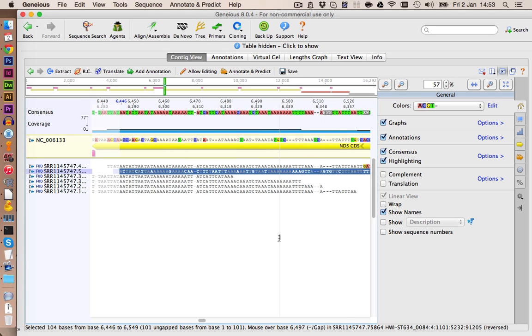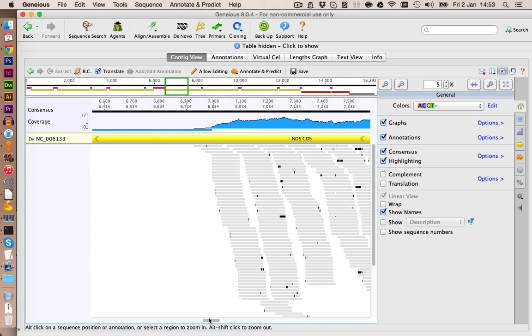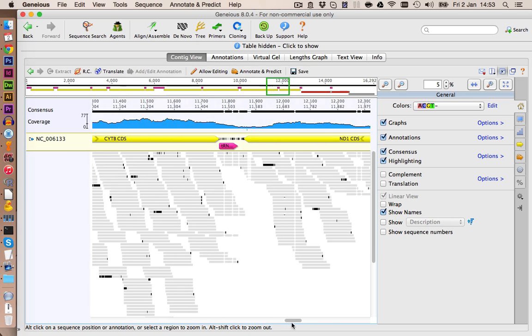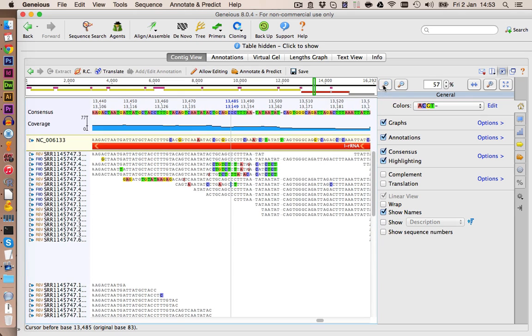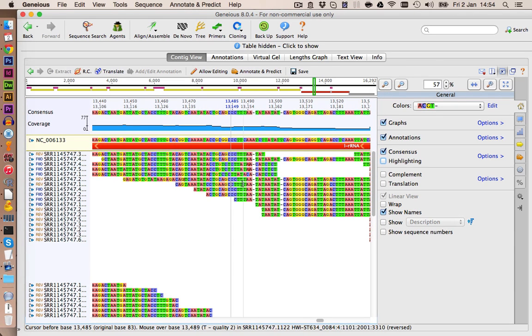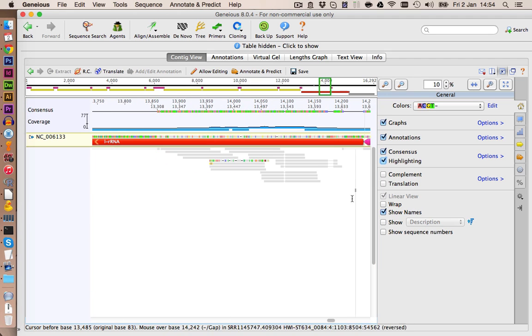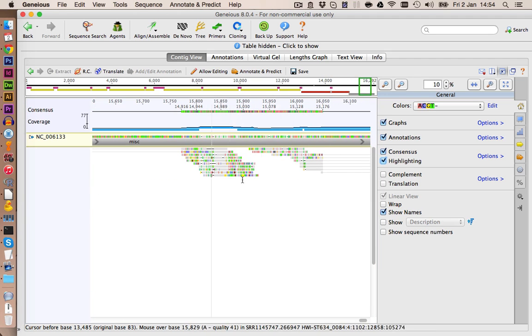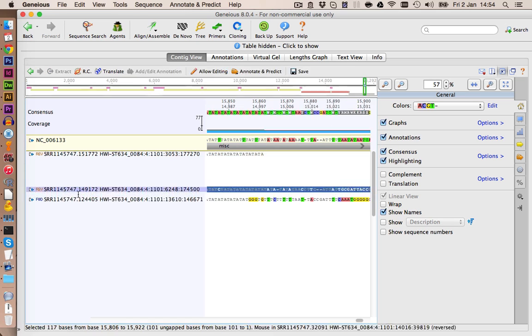Not sure about this sequence as well. Let's delete it for now. This looks good so far. Maybe this here is also a problem. Yeah, it's difficult to decide which sequence here is right or wrong, because this one here is matching quite well. So we're just going to keep it for now. Those sequences here also don't look too good. We delete them as well.